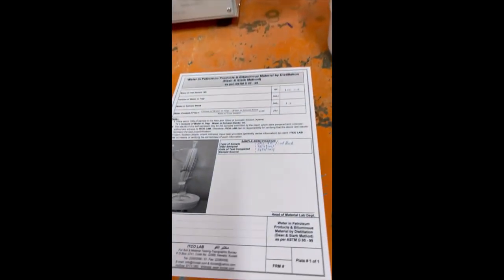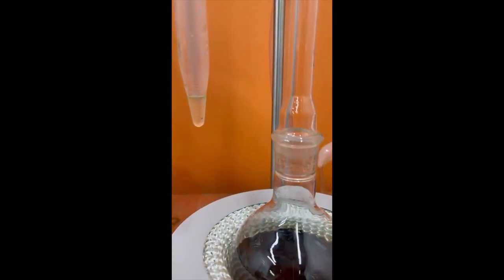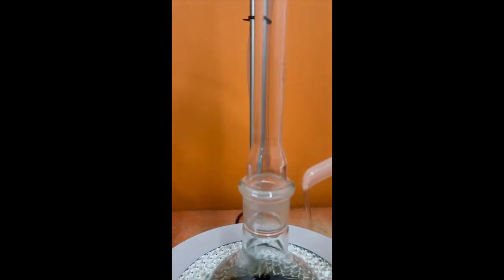And this is the format of the test. Thank you. Now here we can see it starts collecting water in the trap. Thank you.